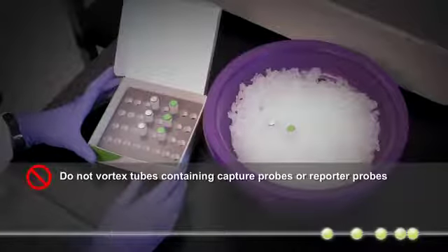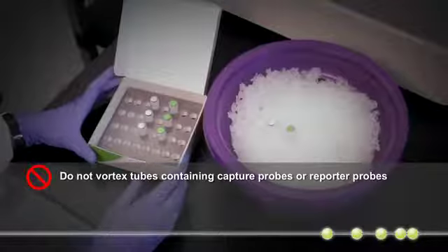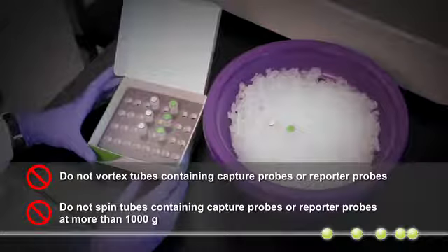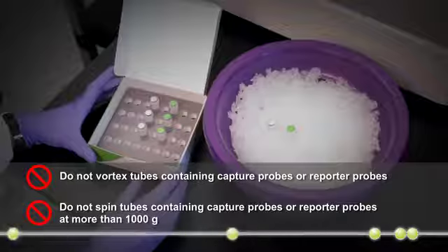Therefore, do not vortex tubes containing capture probes or reporter probes, and do not spin tubes containing capture probes or reporter probes at more than a thousand g's. We recommend using only a benchtop picofuge for centrifuging tubes containing the reporter probes and capture probes.